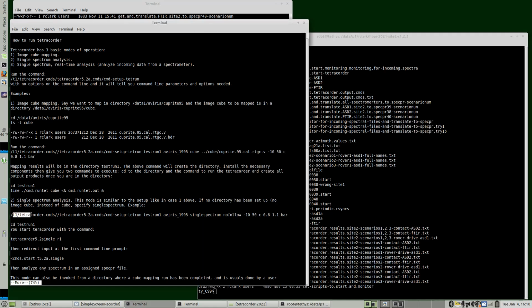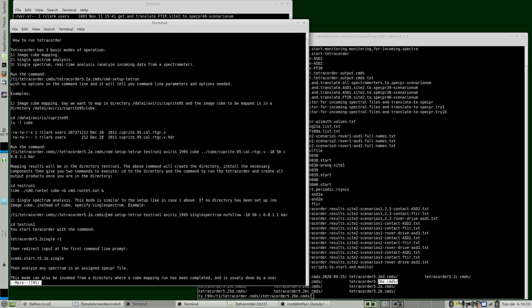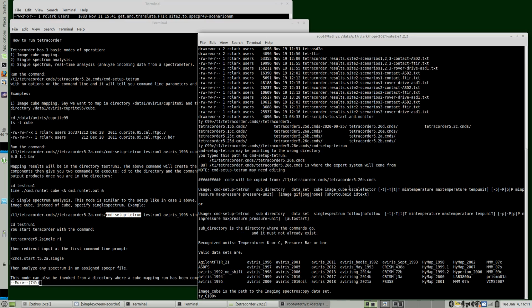We're going to run Tetracorder, but 5.2a is not the most current. So it's really 5.26e commands, and then the command to set up a Tetracorder run is command-setup-tet run. And if you don't know what the options are, press return and it'll tell you.